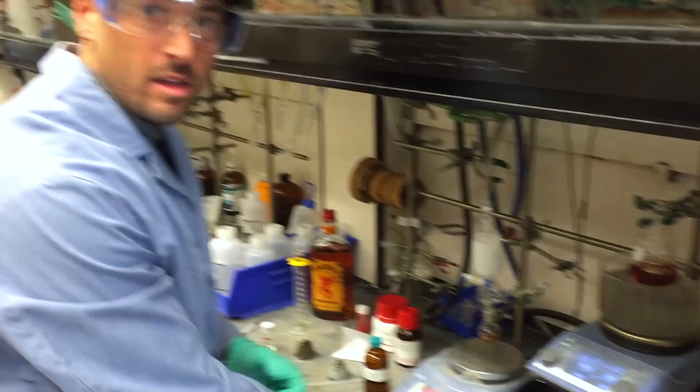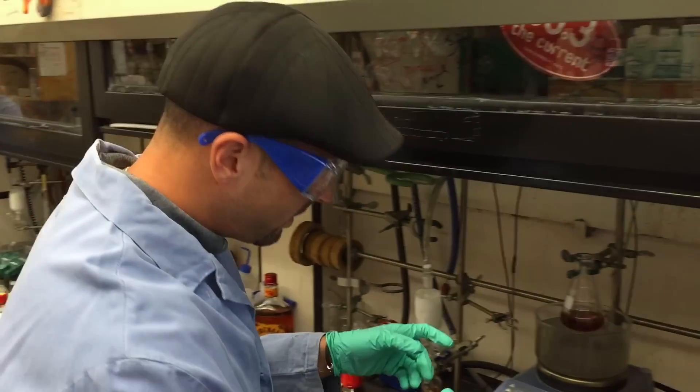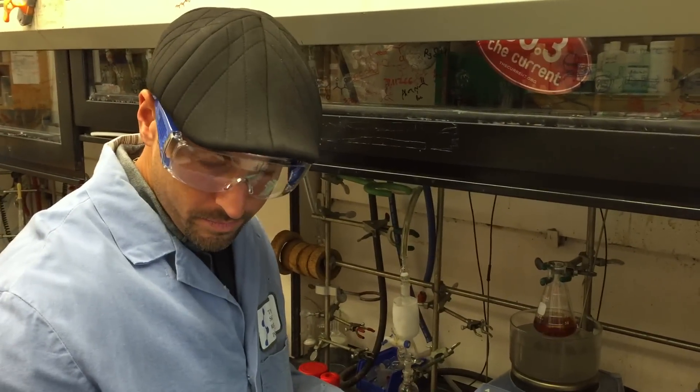Okay folks, that's it. Now all I have to do is put it in the oil bath, then we're going to take a little intermission, we're going to check TLC, and we're going to come back in a little while.